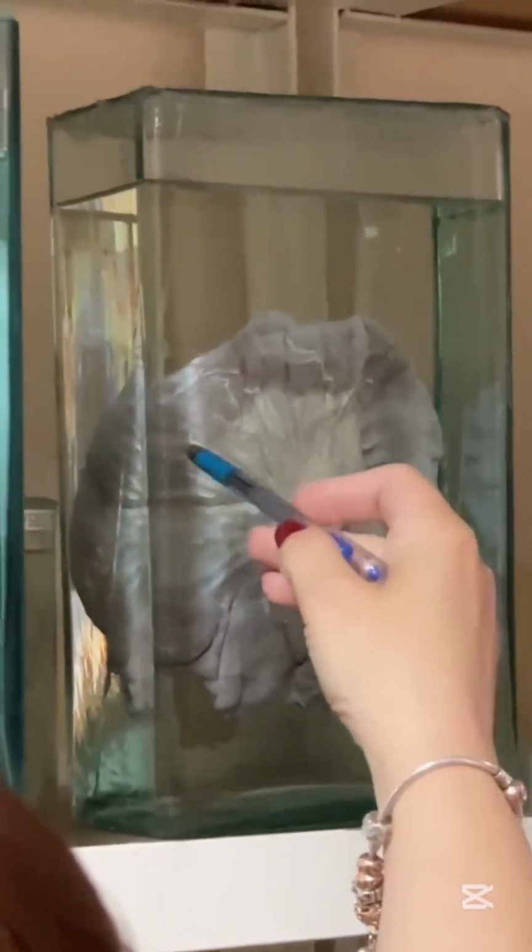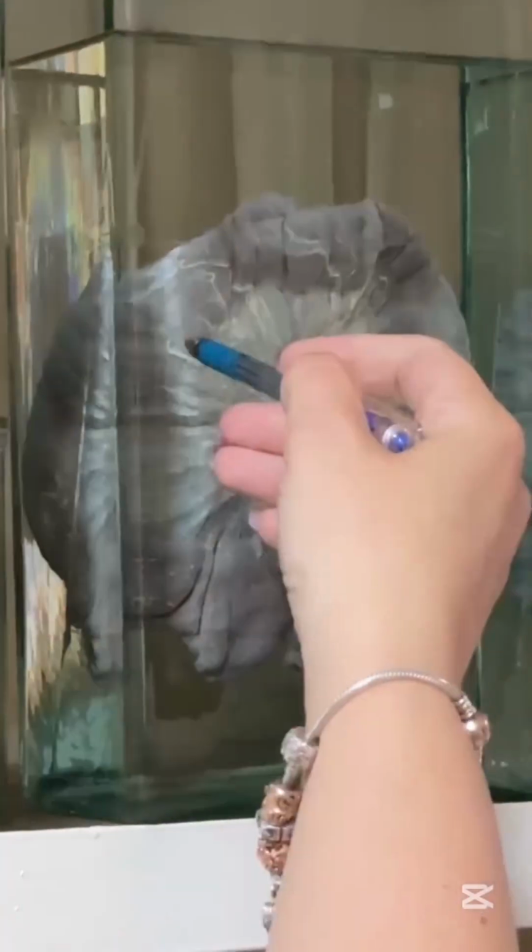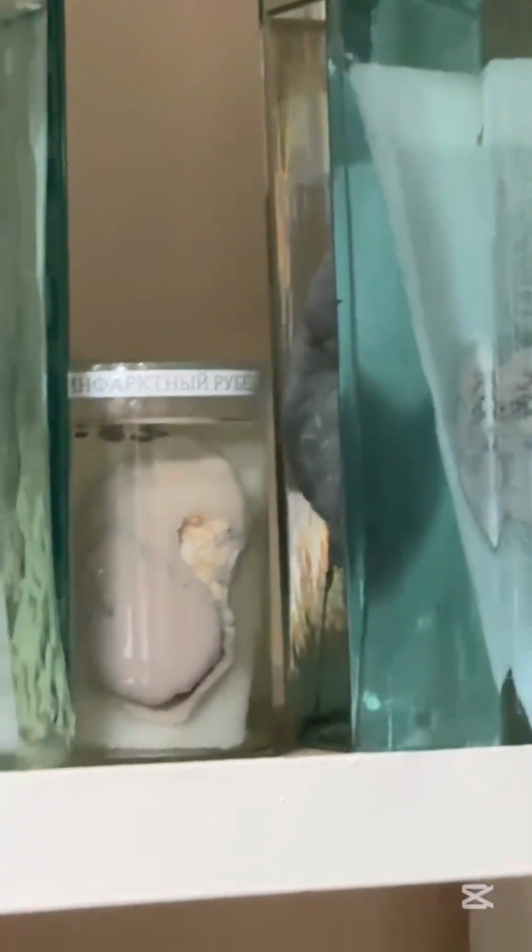Splenic infarction. I don't remember, maybe it's absent in your list, but that is intestine, mesenteric lymph nodes, and you can see metastasis there, white dots. I think it is absent. I will not show you this micropreparate next time.